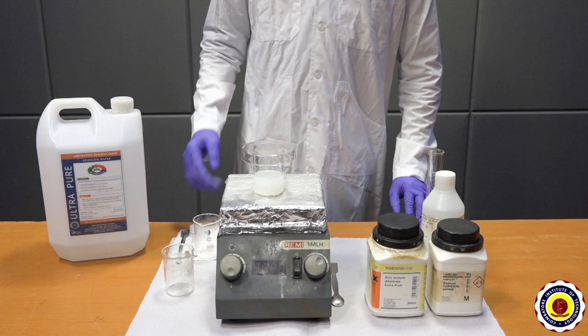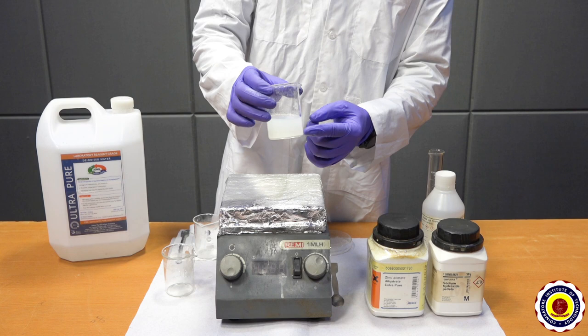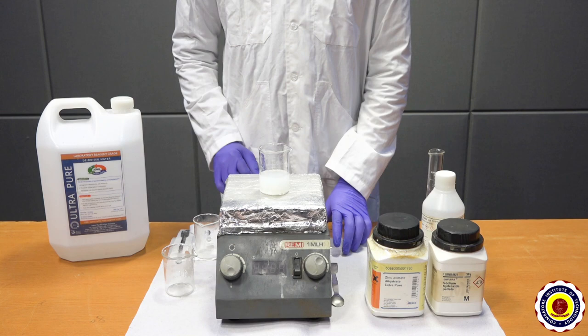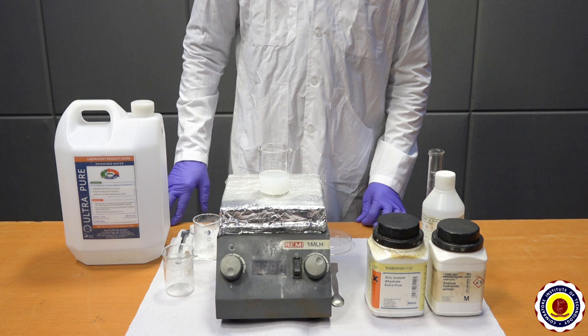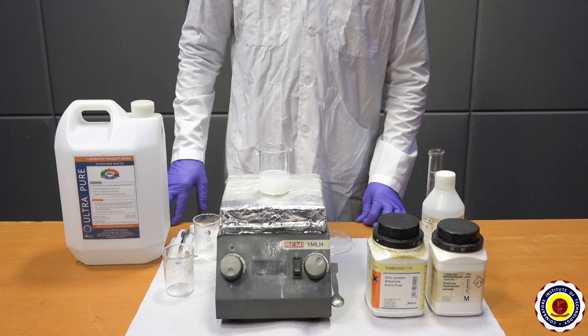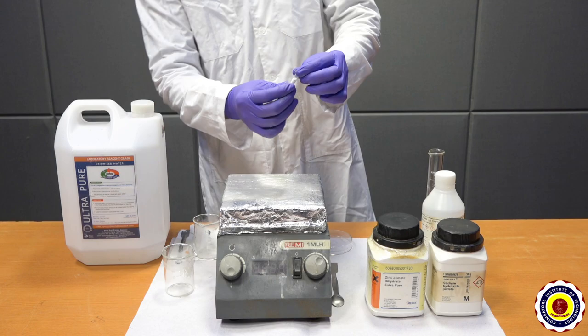After the chemical reaction, leave the mixture without disturbing for 10 minutes. A white precipitate settles down at the bottom of the beaker by condensation process. It contains both zinc hydroxide and sodium acetate. The sodium acetate is filtered by washing repeatedly with water. Now the precipitate — zinc hydroxide colloid — named gel is formed. When the gel is heated at 350 degrees Celsius for an hour in a muffle furnace, a high purity zinc oxide nanopowder is obtained.